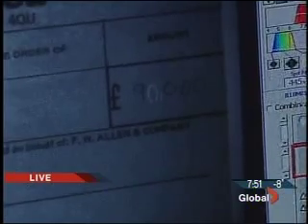Using some blue-green light, we can show that there's an alteration that's taken place, and that we're getting some luminescence off the screen. It was really only 9,000 pounds, and that's one of the things we do here in the documents section, or the Bureau for Counterfeits and Documents Examination section. We bring up alterations to documents to show that they're not, in fact, what they appear to be.